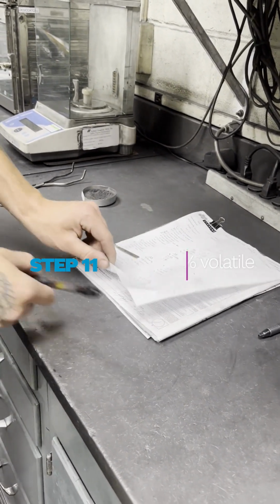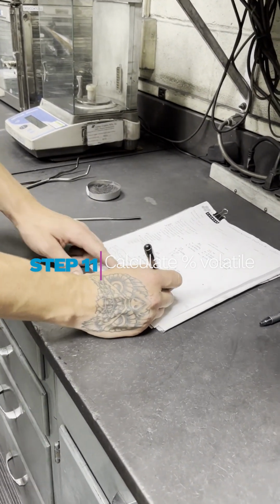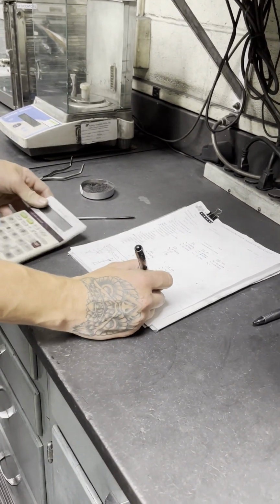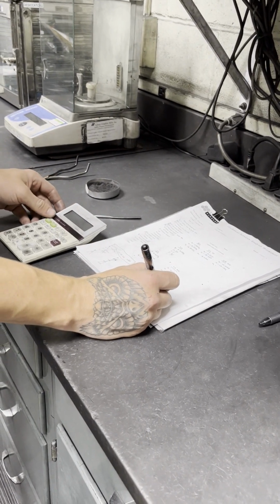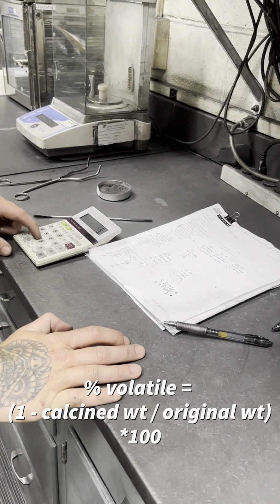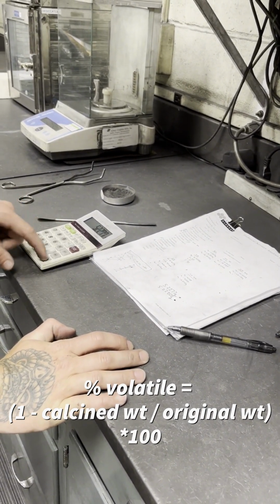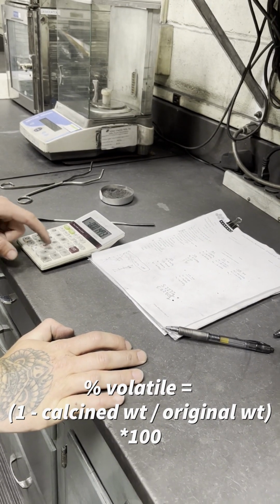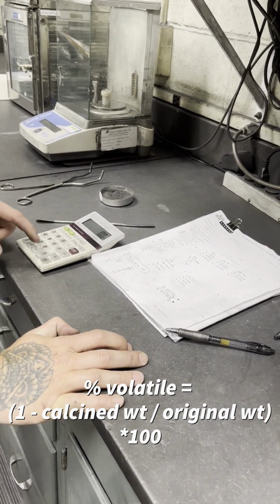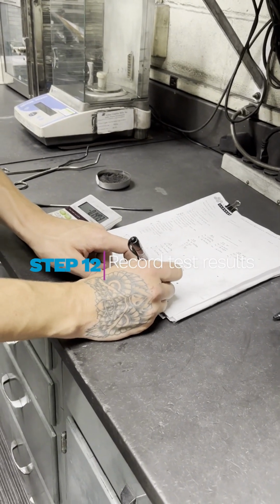Now to get our total percent volatile, what we're going to do is we're going to take our original sample weight and our calcined material weight, and we're going to do some division. So first we take our calcined sample weight and we divide that by our original sample weight, and now we subtract it from 1. And now we multiply it by 100. And our volatile content is 0.15%.